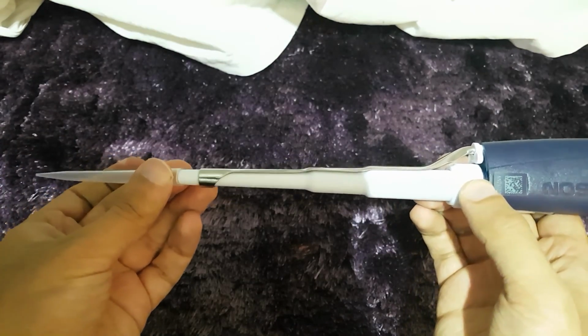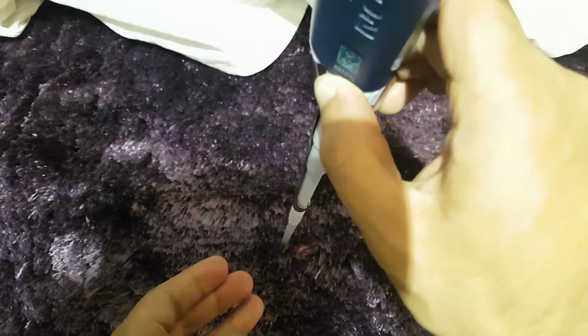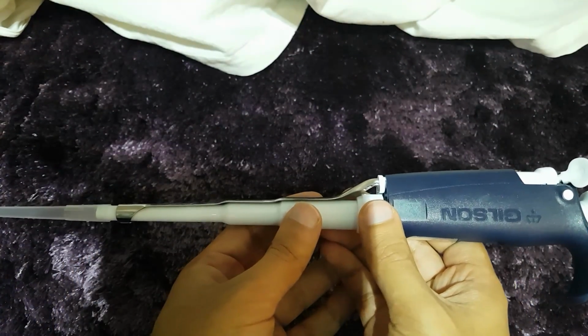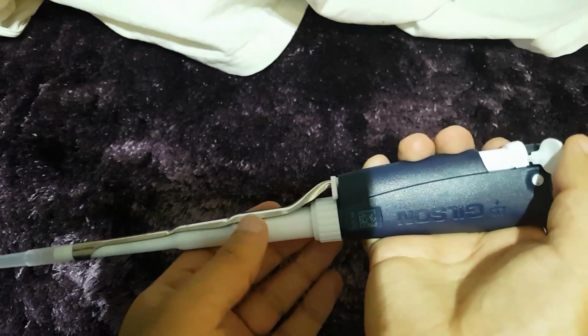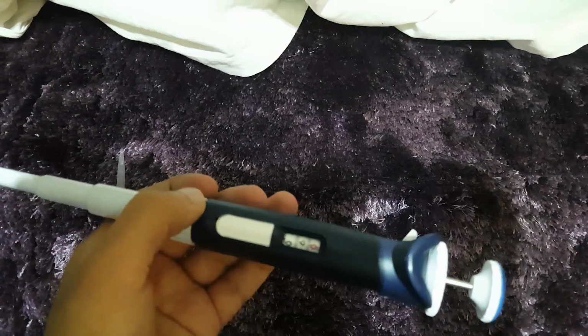Now I'm just going to put a pipette tip onto the end of this pipette, and this just shows you what it looks like. Normally you have a box of tips, but unfortunately I don't have one with me here, but basically this is how it works. And to eject the tip, you literally press down on the ejector button.